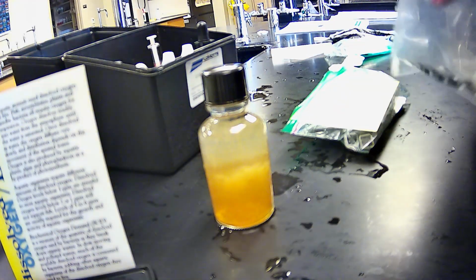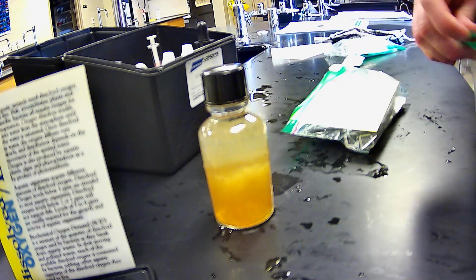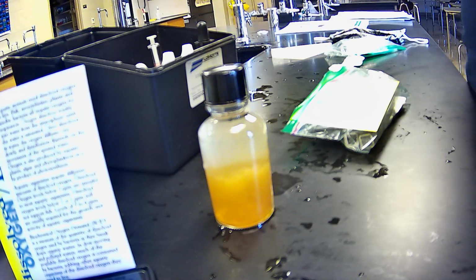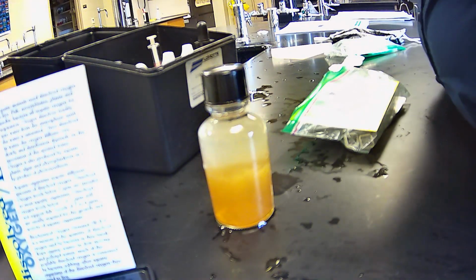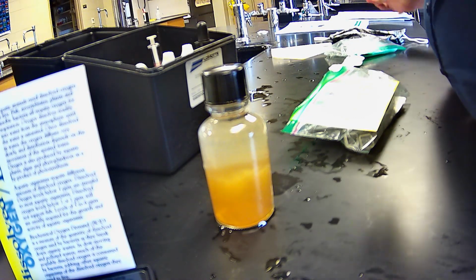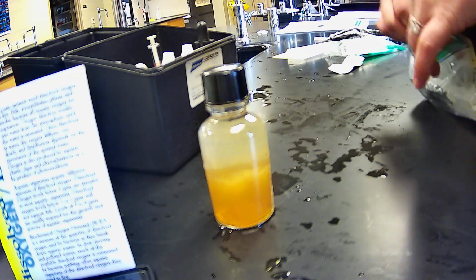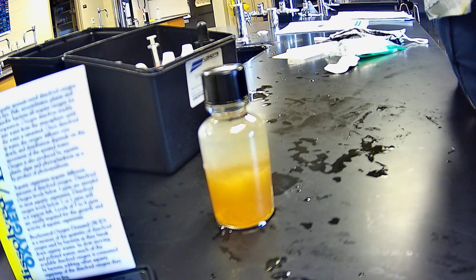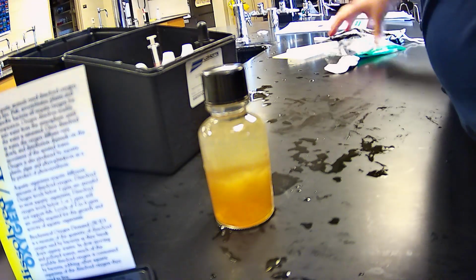If any teachers are out there, I get all of my stuff from Carolina. These were LaMotte, but I had a grant for that. This is actually a very old dissolved oxygen kit, and I find that it works better than the newer one. I don't know if there's any validity there, but I found success with that. I also enjoy the Carolina bag. I think that's really nice as well. And I haven't really found anything else, so if you know of something, please let me know. But that's what I know.